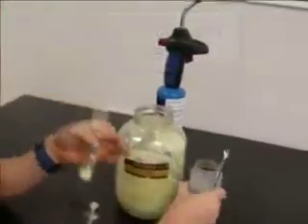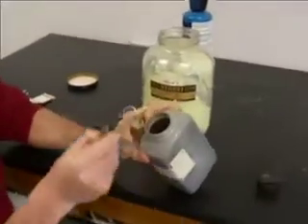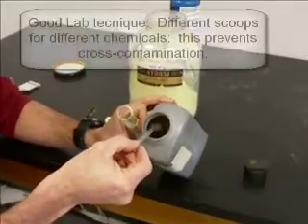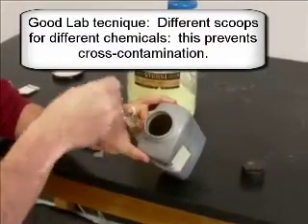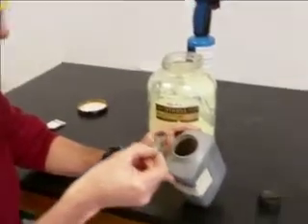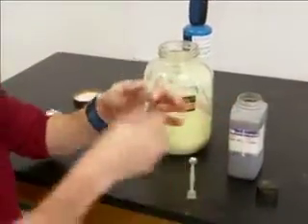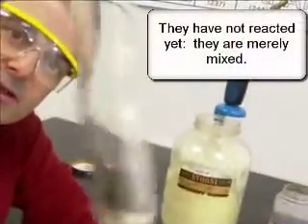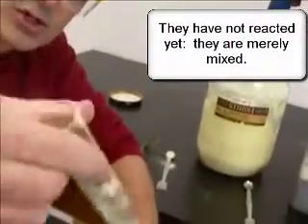And then to that, I'm going to add some iron metal. Now, notice one thing I am doing as I'm mixing these. Notice I have different scoops for each of them because I do not want to put sulfur into the iron. It's not a good idea. So here is iron mixed with sulfur. Now, notice they're not reacting. They're just kind of mixed together, sitting there. So I'm going to shake them up.